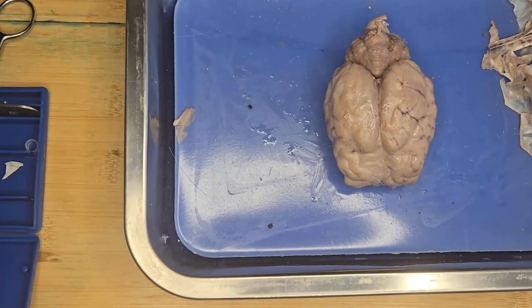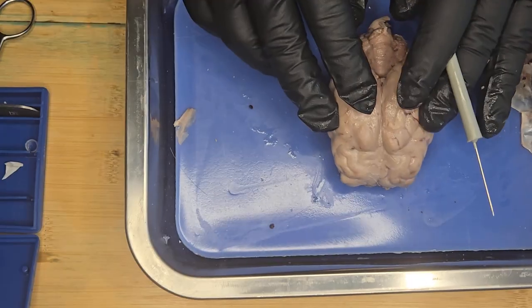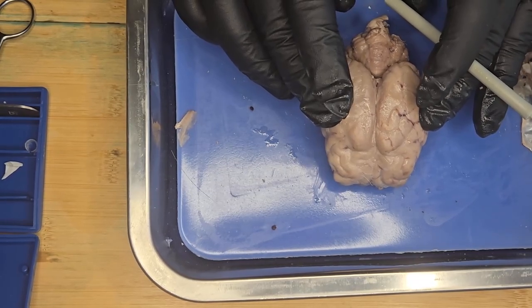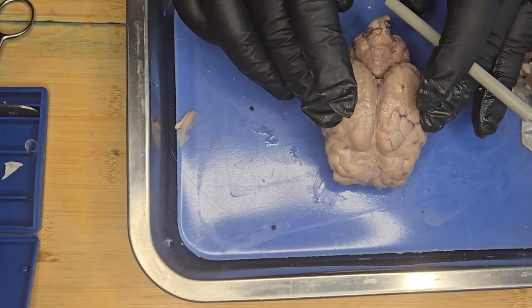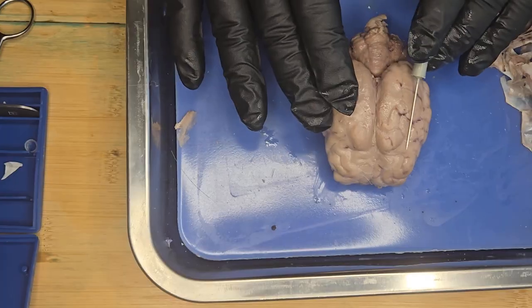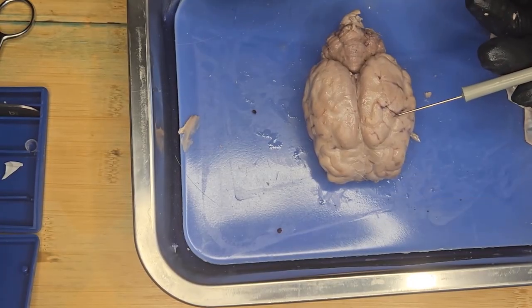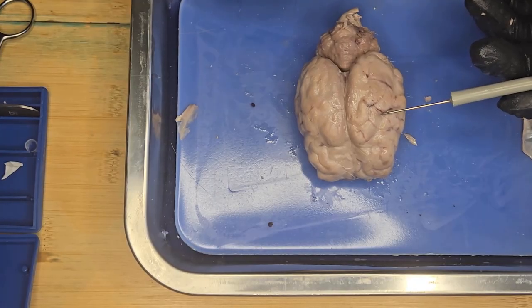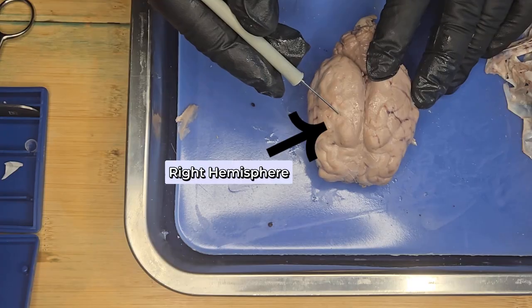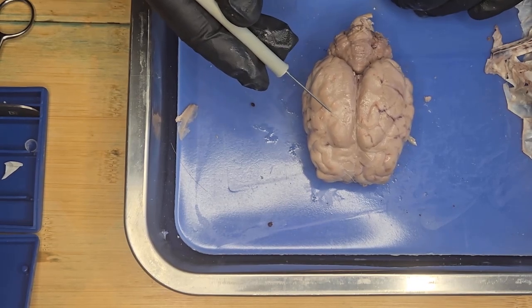What we have here is the cerebrum. And the cerebrum is the largest and most complex part of the brain, responsible for higher brain functions. It is divided into two cerebral hemispheres. So here we've got the left hemisphere, and the left hemisphere is responsible for language, logic, and analytical tasks. The right hemisphere here is responsible for spatial ability, creativity, and facial recognition.